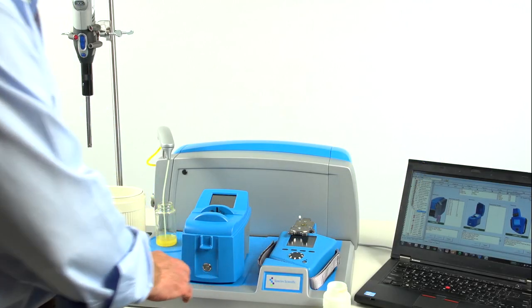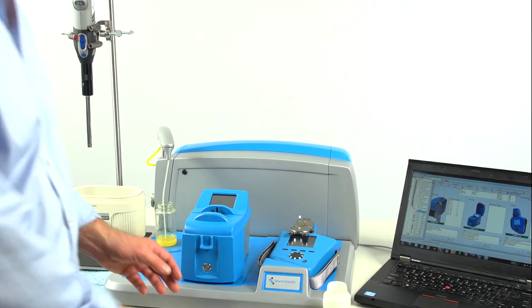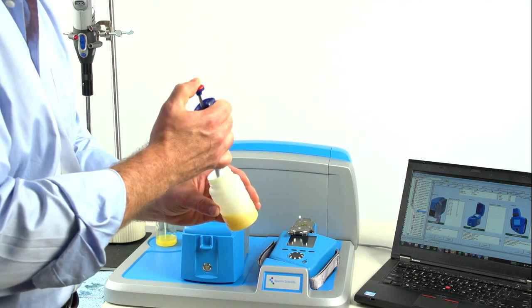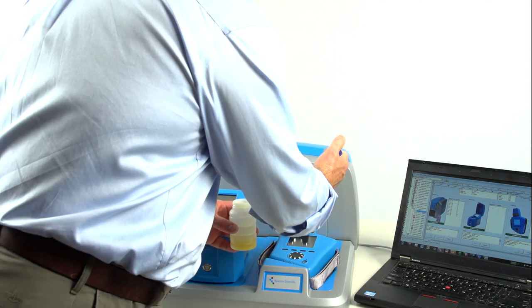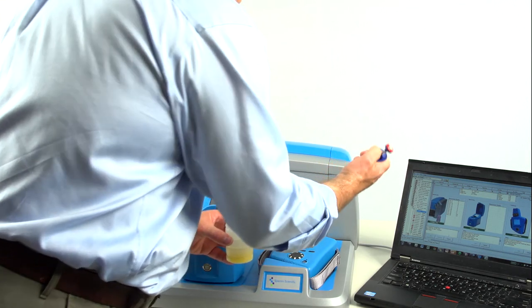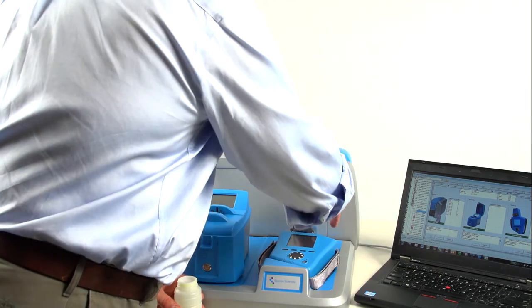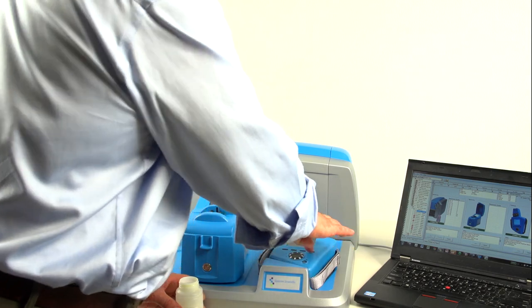Now, I'm going to make a measurement on the FluidScan while the LNF is processing. Again, a single drop of oil is what's required. Just close the flip-top cell and start the measurement.